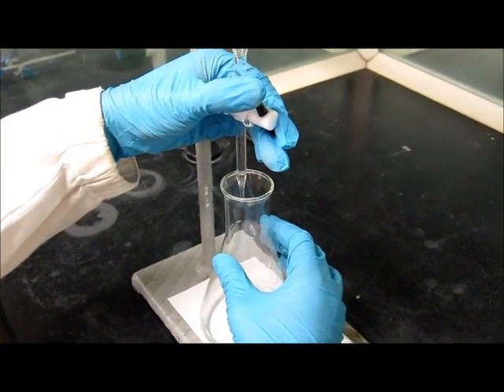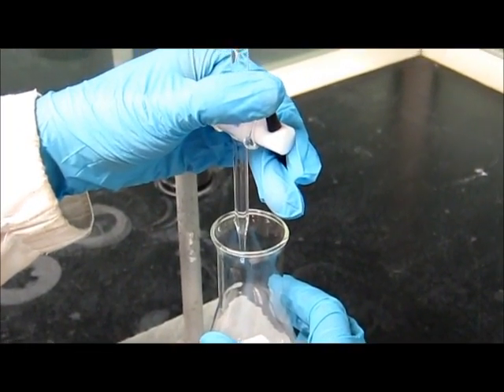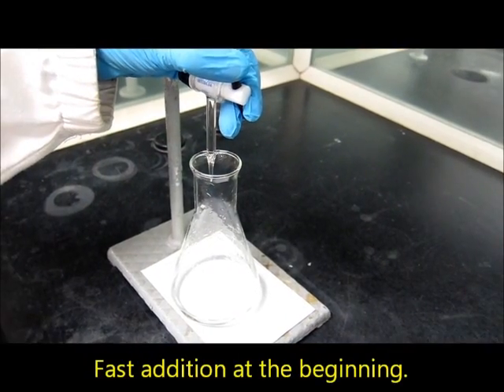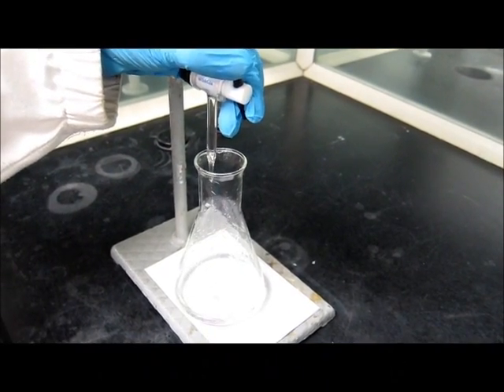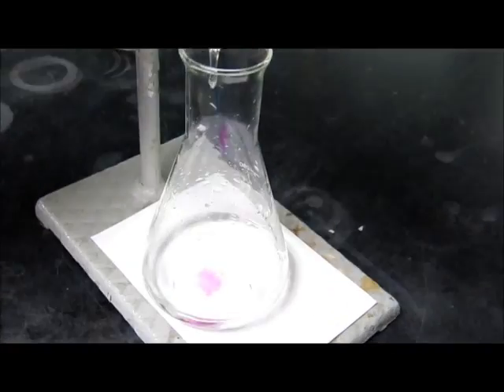You see, you have to really slowly and carefully maneuver the stopcock. So there's this fast addition at the beginning. And you see a localized colour change.